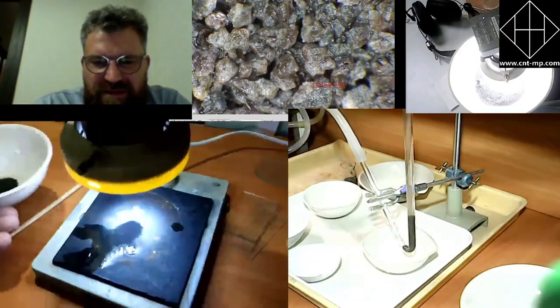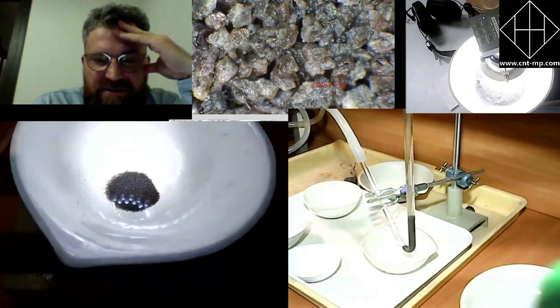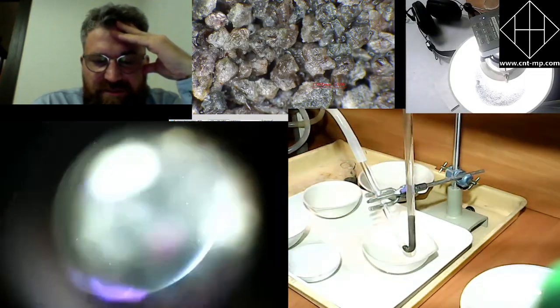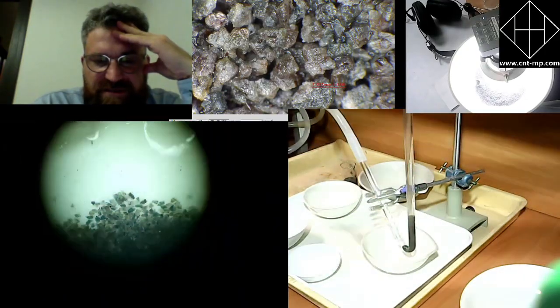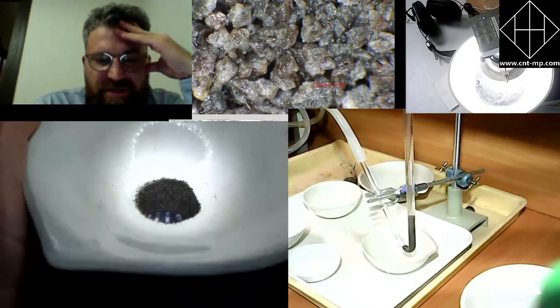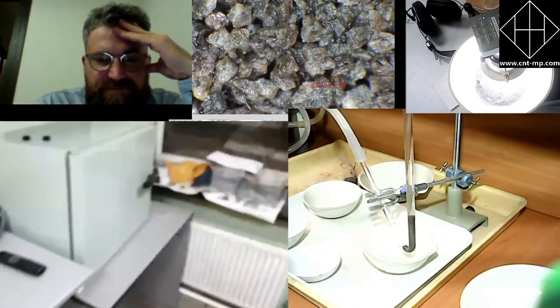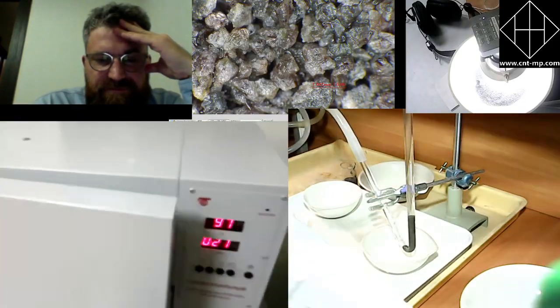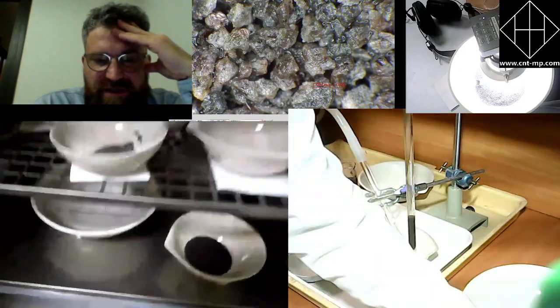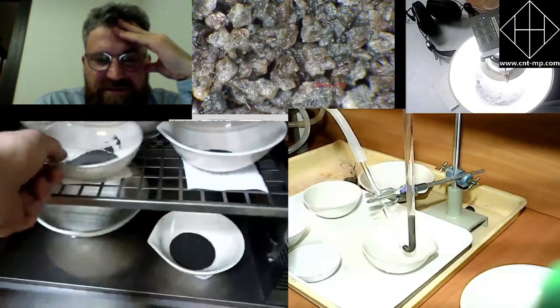But I hope that Alek will now pay more attention to the product, because we have shown already the hydroseparation process. Yes, Oleg is doing some microscopic observation of the final product. Let's see what is there. Yeah, there are separate particles. Hopefully he will be able to find some sulfides there.